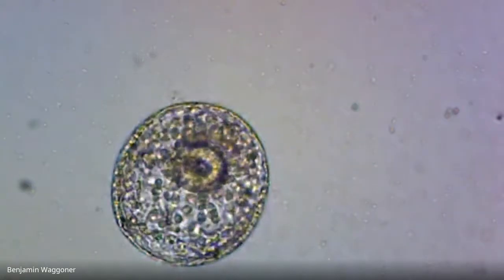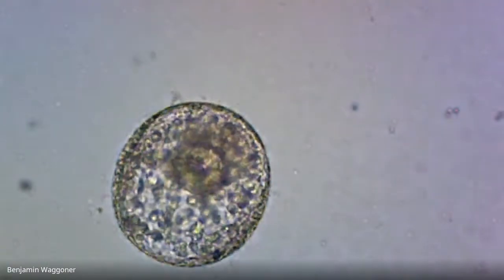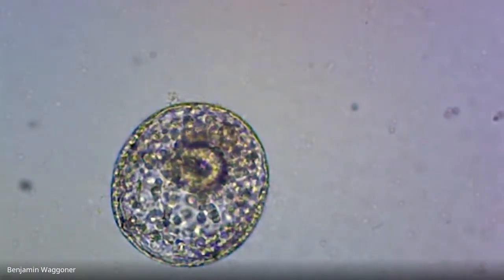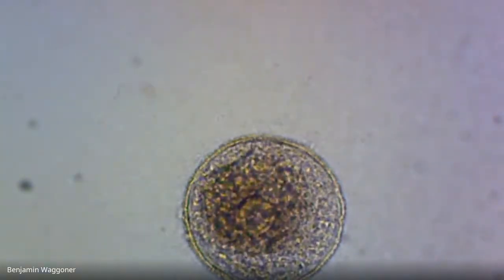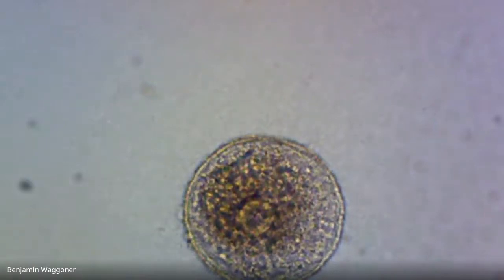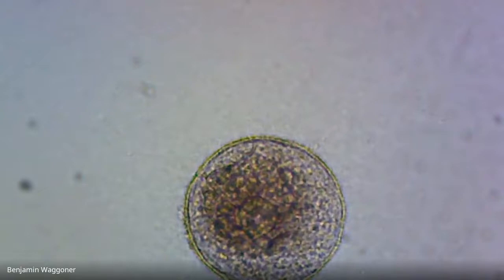And there's another gastrula. Yeah, if it's still primarily round, I'm going to call it a gastrula. If it's starting to show that conical or pyramid shape, we can call it prism. And that got to gastrula stage before the bacteria zapped it, I think.